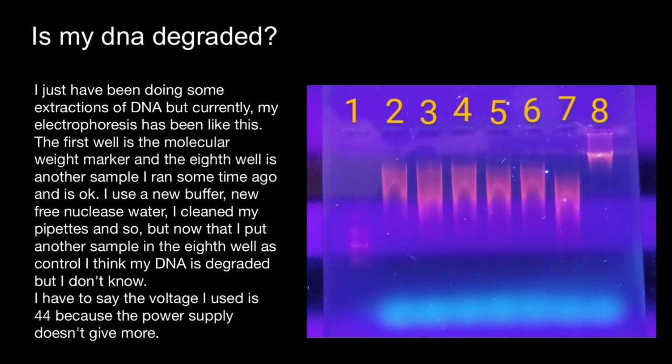This smearing here is also an indication of DNA degradation. The low voltage stated by this researcher is not a problem here, because low voltage usually gives better results than high voltage, so running parameters are not the only problem here. If the power supply is delivering high current and not reporting it, this can be a problem. As you see, degraded samples are smearing badly here, which means there is too much salt in the gel.